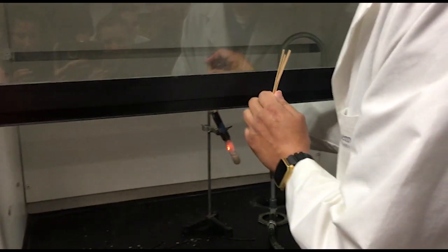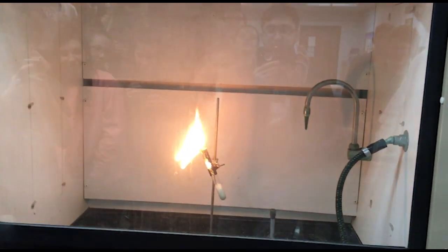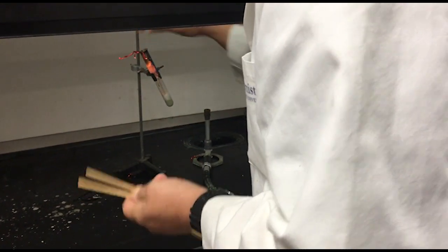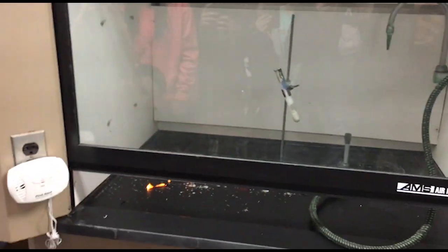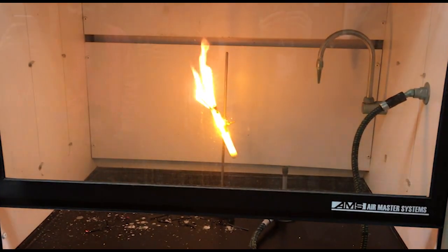Woo! That's pretty. Three splints here and see what happens. Oh, hello. Four. I think all of them. Four. Just put them all in there right now. Woo! That just launched right out of there. All right, put them all.